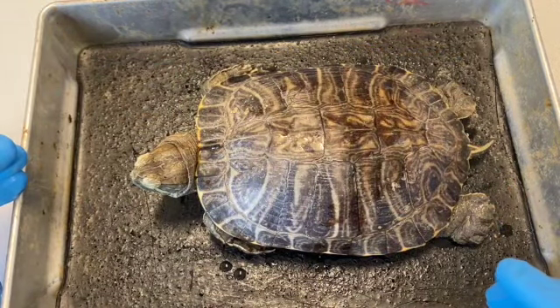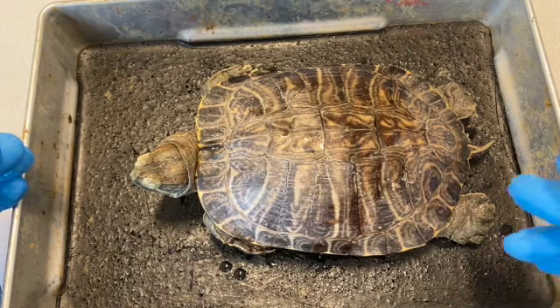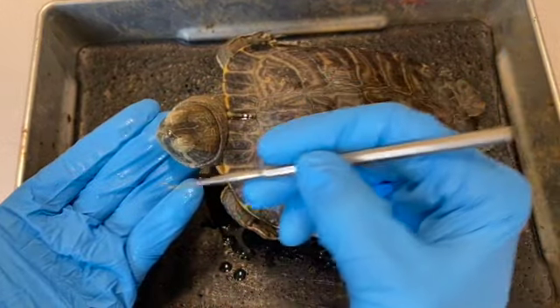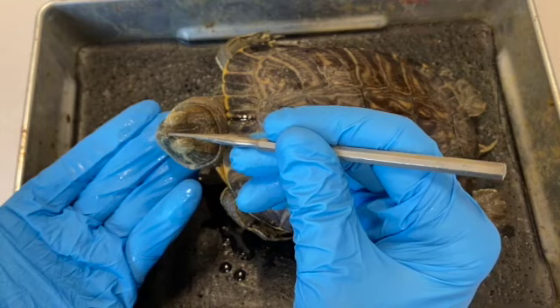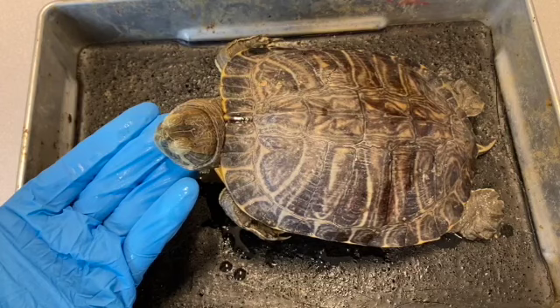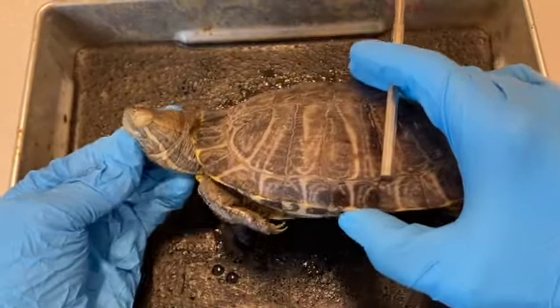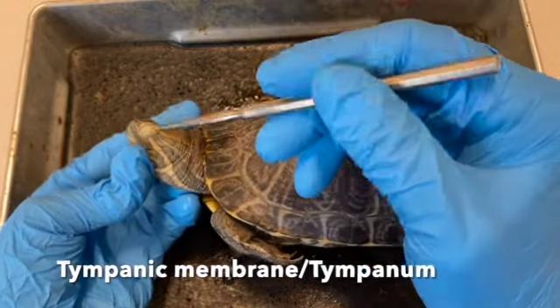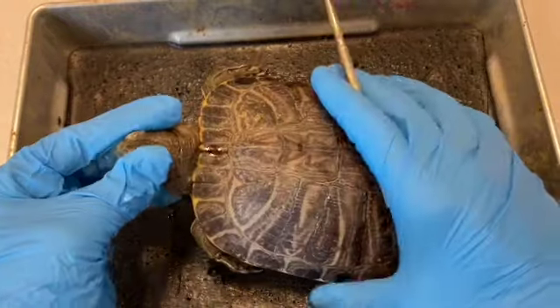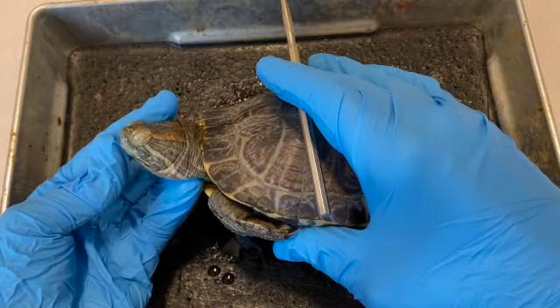Now let's take a look at the external anatomy of the soft tissue and other structures aside from the shell. Let's start at the anterior end, and what we can see here on the head, very small openings, a pair right here. These are the nares, external nares. The eyes are located here, and the tympanic membrane is a little tougher to see. It's a circular structure on either side of the head that allows them to detect vibrations or hear.